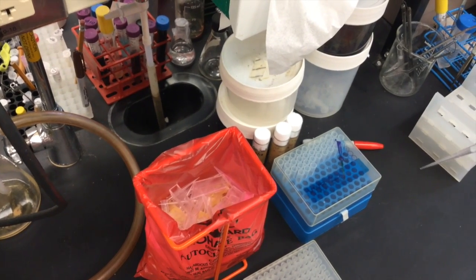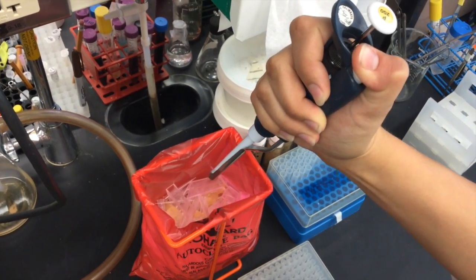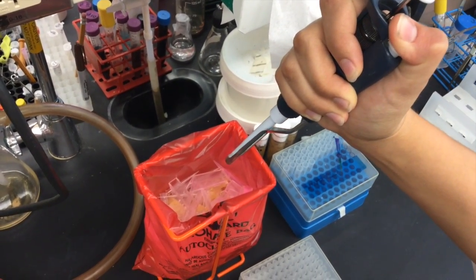Now you can discard the tip by pressing down on the plunger completely and disposing of the tip into the proper waste container.